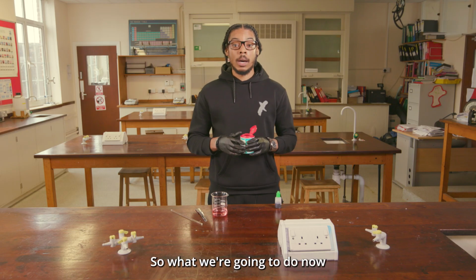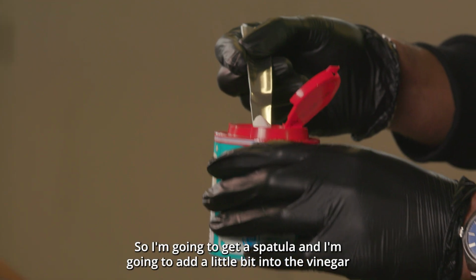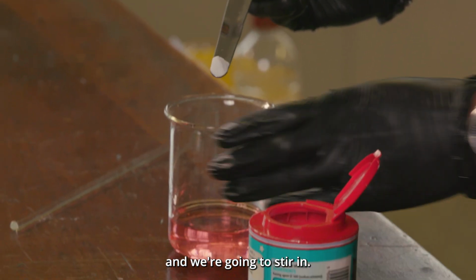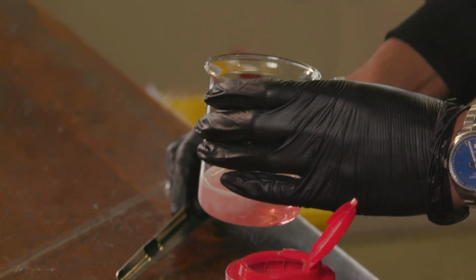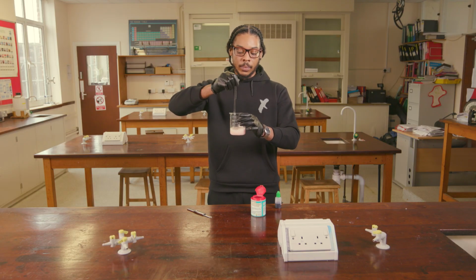Right, so what we're going to do now is neutralise the vinegar by using some sodium bicarbonate. So I'm going to get a spatula and I'm going to add a little bit into the vinegar and we're going to stir it in. So we can see some fizzing taking place there.